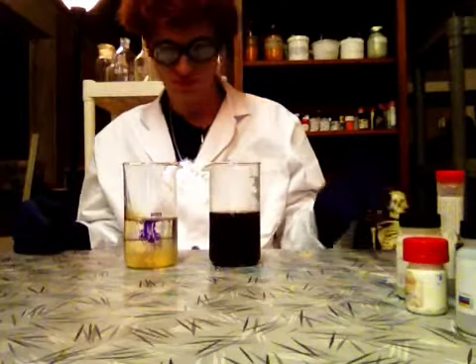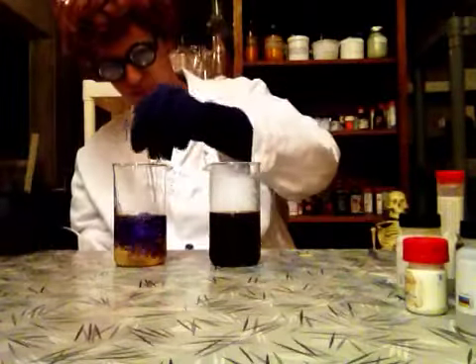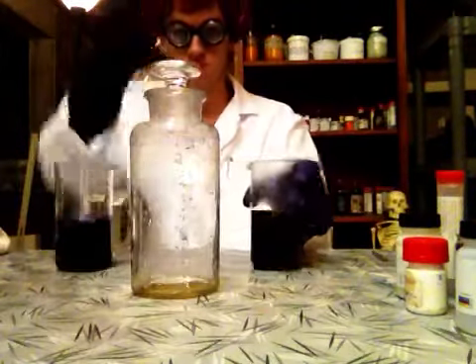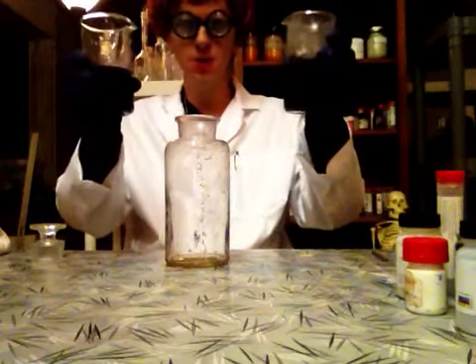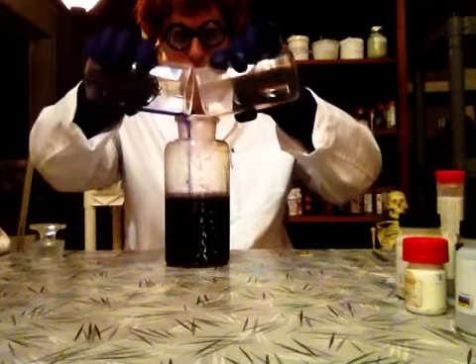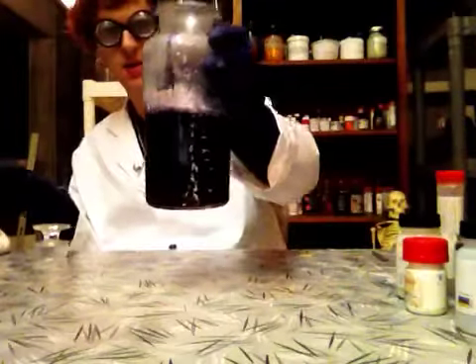Look at that — it takes on a purple color. Purple. Watch out viewers — who knows what's going to happen? No one knows. I will do something. It's bubbling, and you see the top of there? Bubbles.